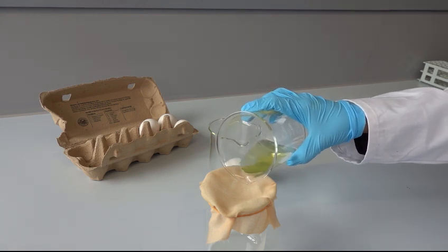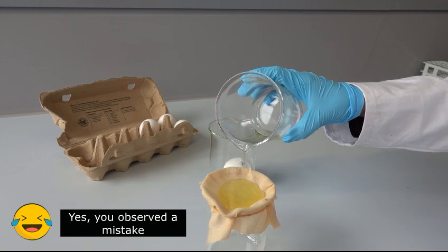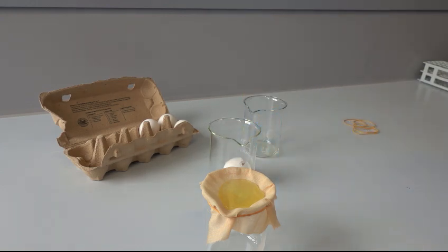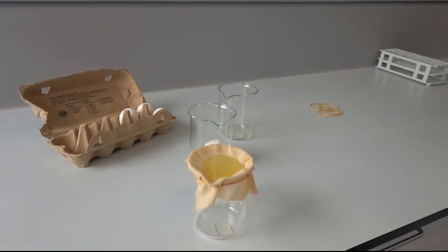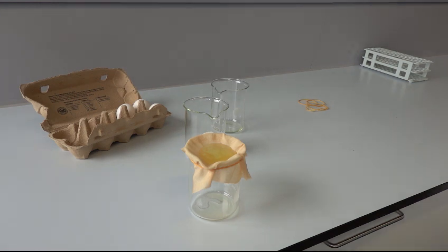Slowly pour half of the egg white. Wait for at least 10 minutes to let the liquid part separate from the viscous part.